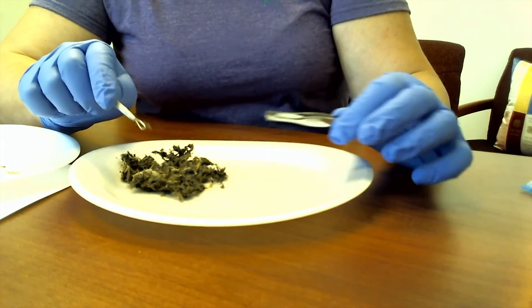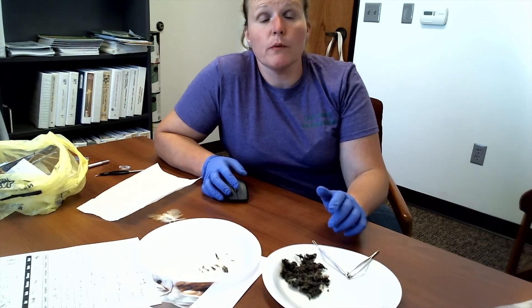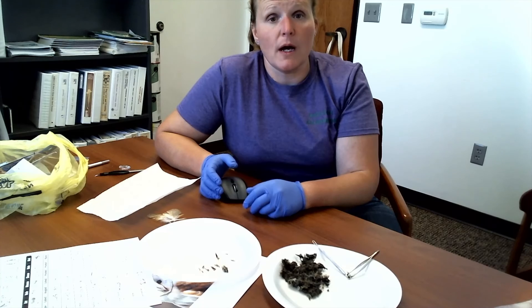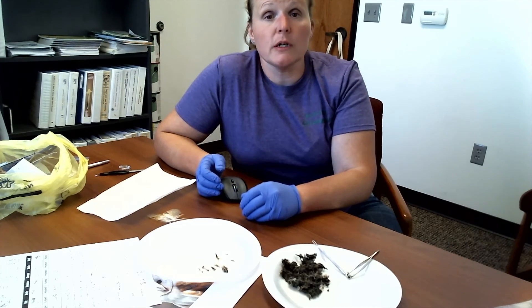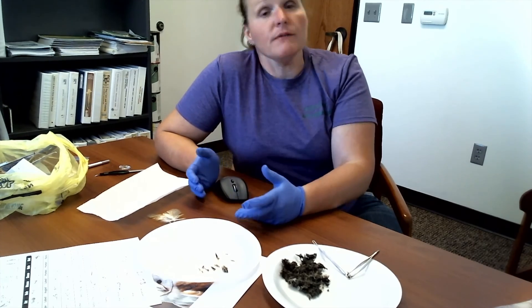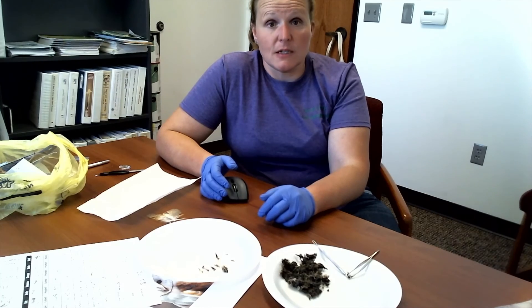It's pretty interesting to see what the owls in our area are eating and how they digest. While you're doing this owl pellet dissection, a good component would be to take pictures at each step — the whole owl pellet, and then as you pull it apart, the different pieces that you find. Photograph that and do a scientific or educational poster on it as well. Put your pieces on a separate plate, put them in order, and try to rebuild your critter to see if you have an intact skeleton. It's kind of neat if you're in the Wildlife Project to take a look and see what's going on around you. For this activity and more, follow us on the Finney and Scott County 4-H Facebook pages and on the West Plains Extension District YouTube channel. Have a great day!